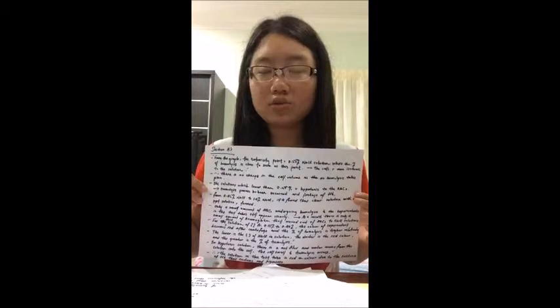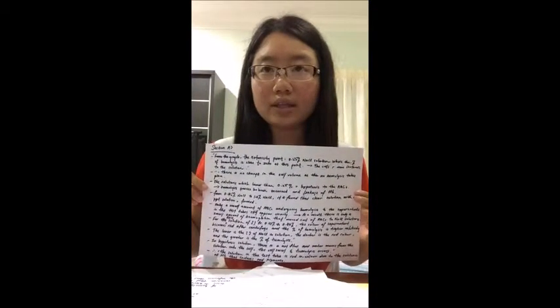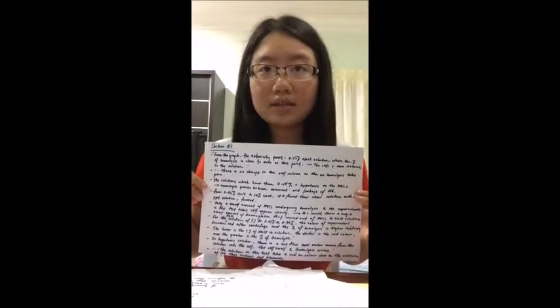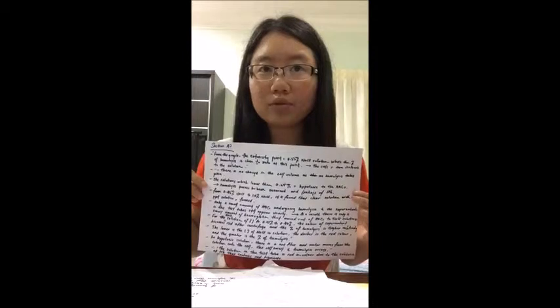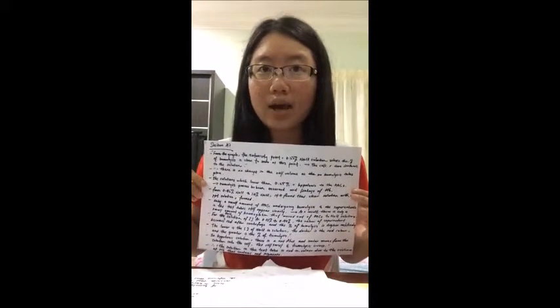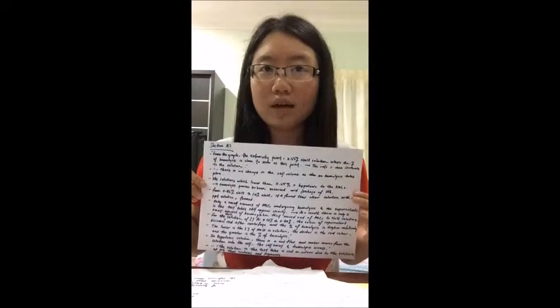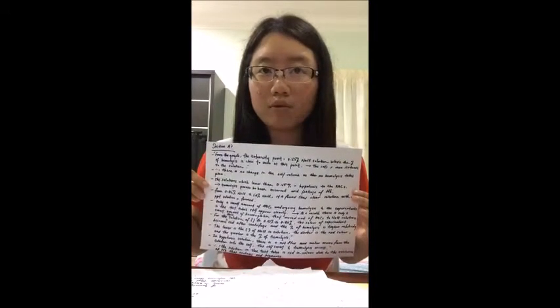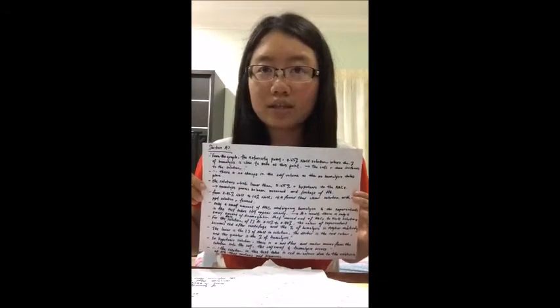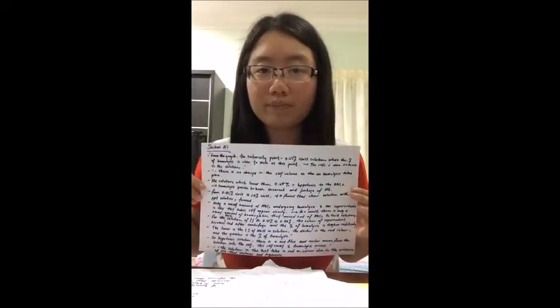The lower the concentration of the sodium chloride solution, the darker the red color and the greater the percentage of hemolysis. This is because the lower the concentration of sodium chloride solutions, the more hypotonic the solution is to the cell. In hypotonic solutions, there is a net flux and water moves from the solution into the cell, the cell swells and hemolysis occurs. It causes the pores in the membrane to become larger and permeable to hemoglobin. Therefore, the solution in the test tube is red in color due to the existence of hemoglobin, which contains red pigments.